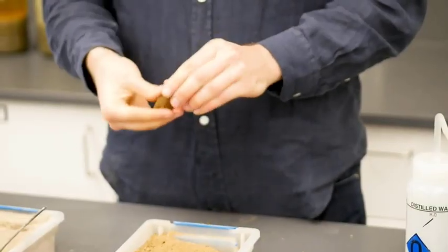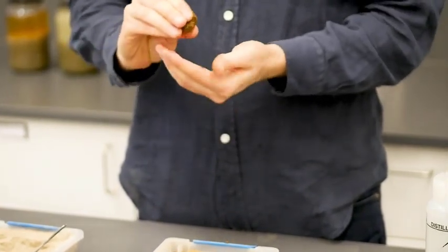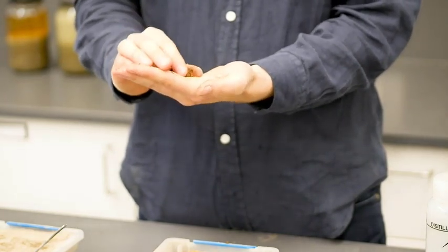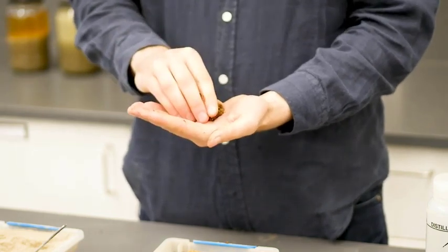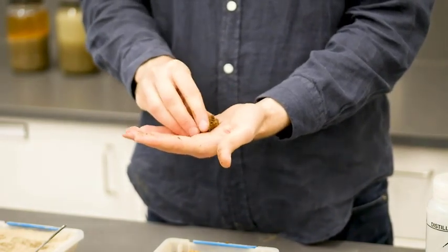So some additional considerations when you're determining your soil texture are the stickiness test. You can compress your soil sample between your fingers, and when you pull it apart, see how much it sticks to your fingers and how much it stretches. So the more stretchy and sticky your soil is, the more montmorillonite clay there is present.